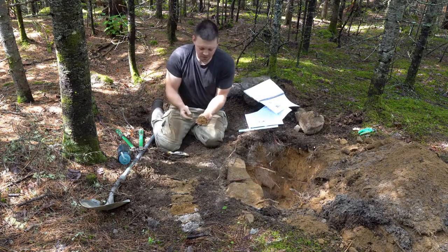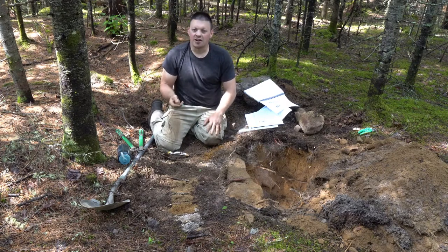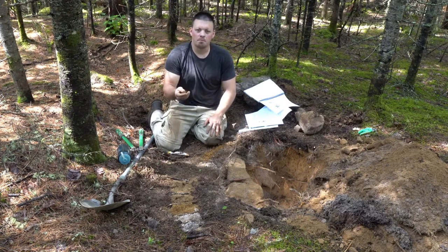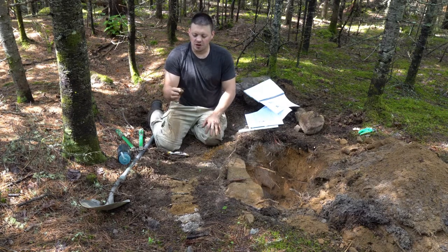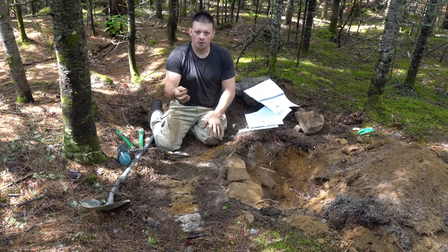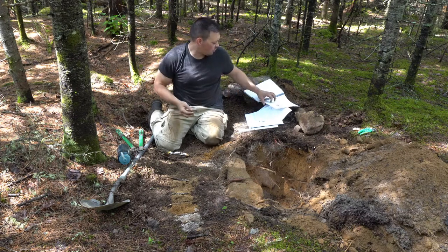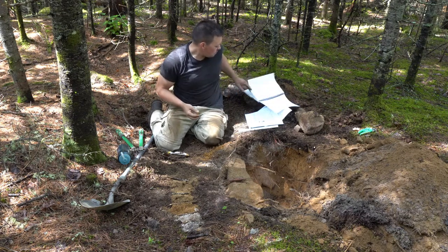And we take a piece, and this is the structure of the soil. The structure is the aggregation or the ped that forms from the binding of individual soil minerals and particles. So this is our structure, and you can see that roots and other things help hold the structure together, or the ped together. With soil structure, it is on page 29 to 32 of your lab manual.